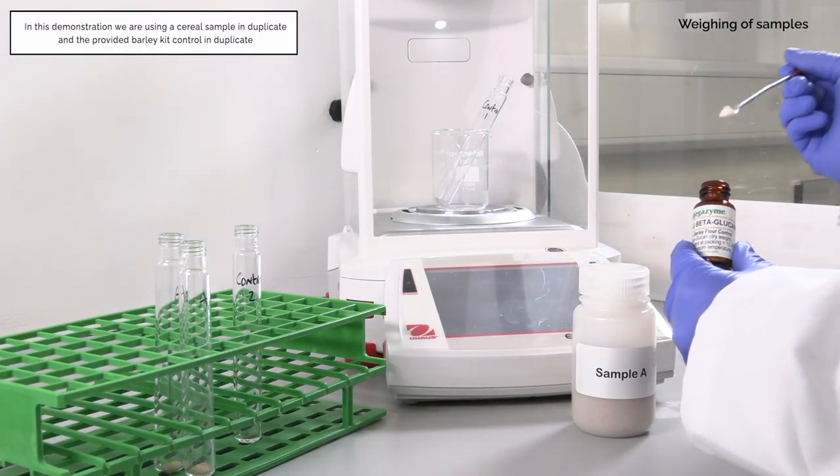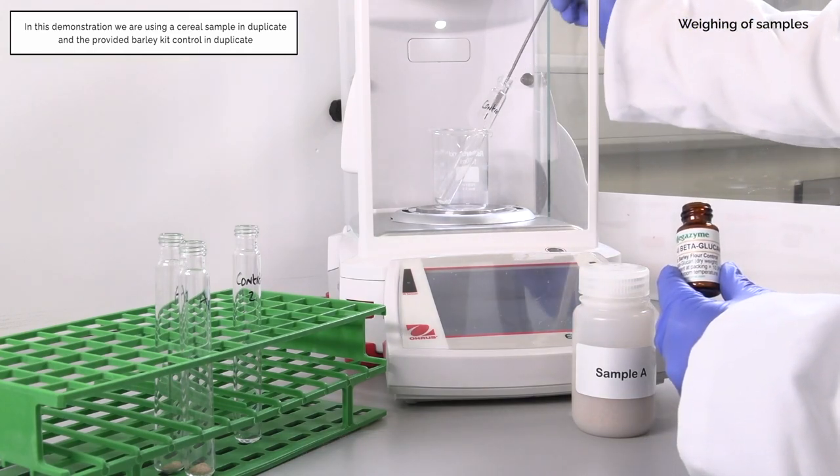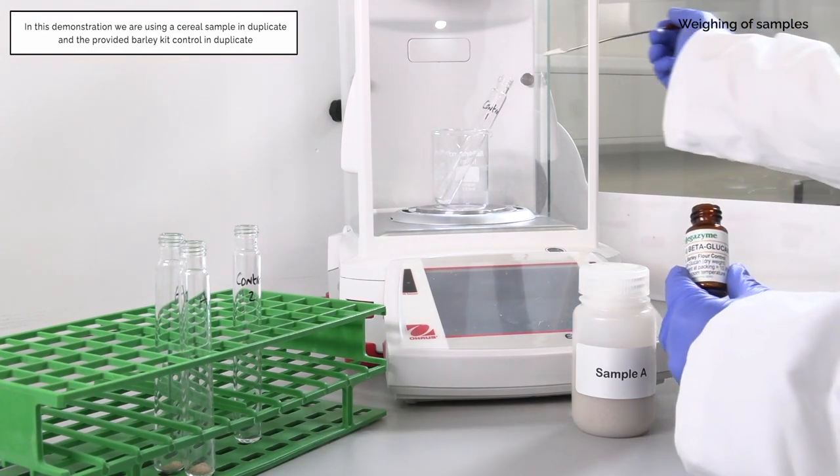In this demonstration we are using a cereal sample in duplicate and the provided barley kit control in duplicate.